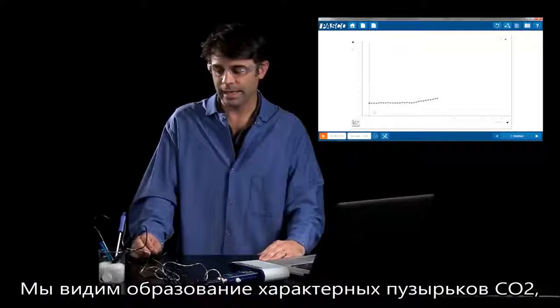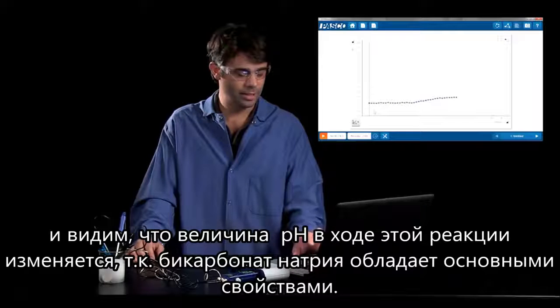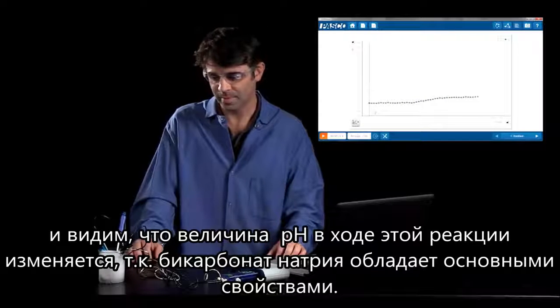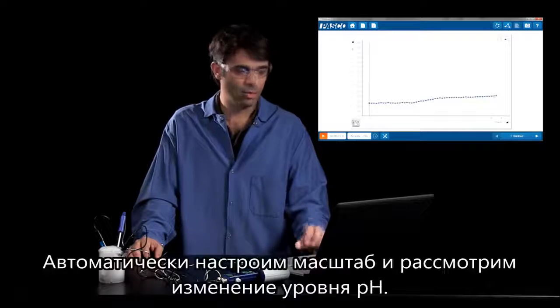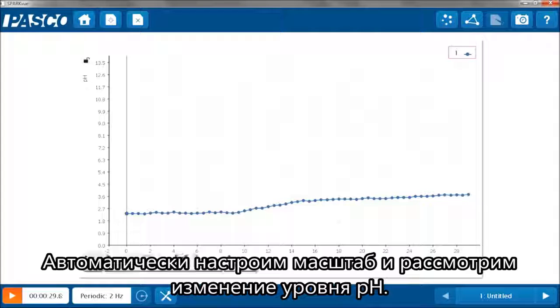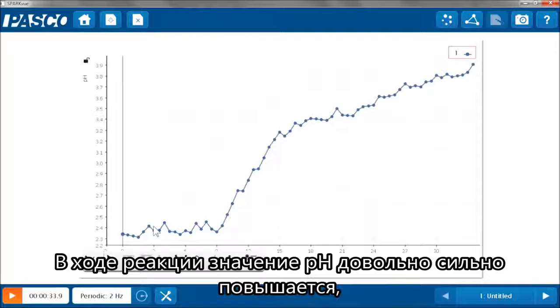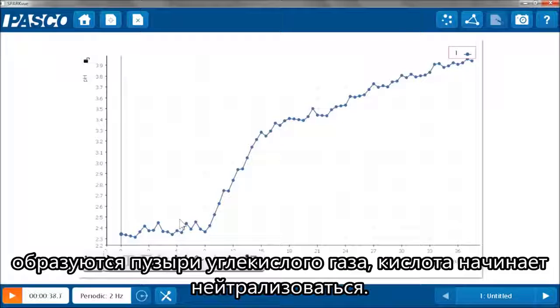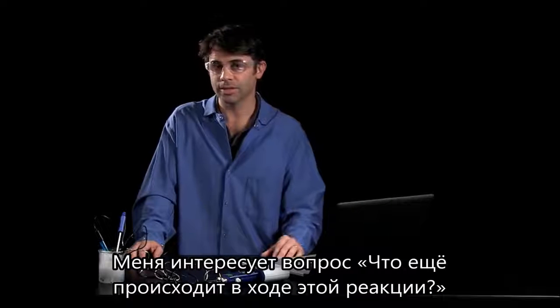And we get our characteristic bubbles of CO2 forming. And we can see that the pH is changing because of that, the Alka-Seltzer being an antacid, or a base in this case. We'll auto-scale this and see how the pH is changing. There's a pretty dramatic rise in the pH as the reaction proceeds, the bubbles form, and the acid is beginning to be neutralized. But now the interesting question is, what else is happening in this reaction?